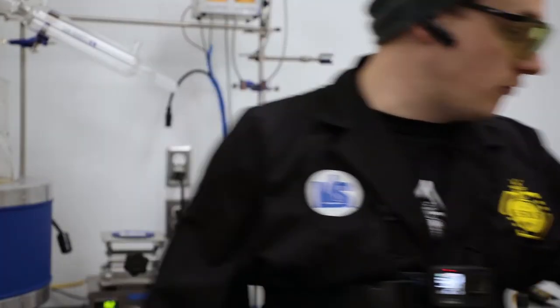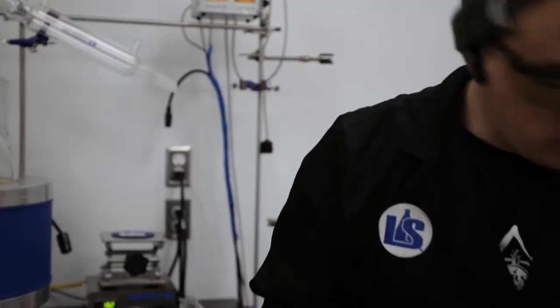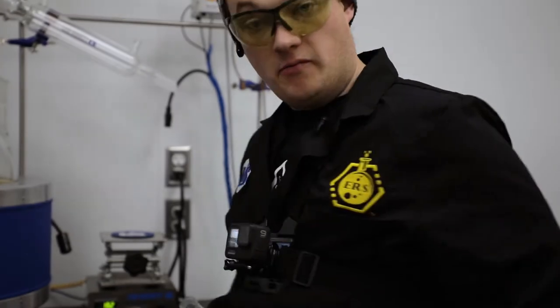We're going to use the Rotavis cap today, so we'll go over the assembly of that and we will make this thing ready to go.